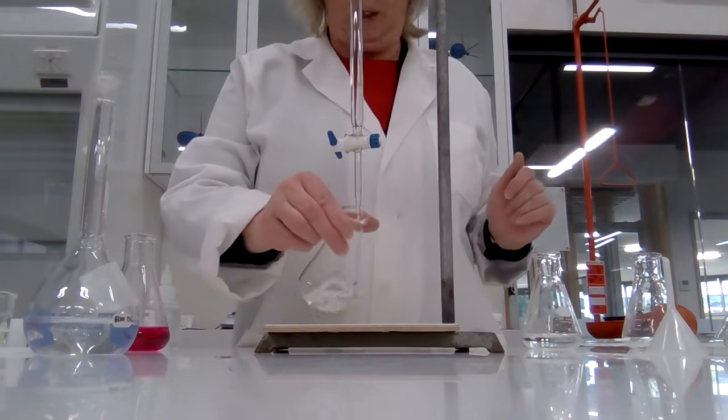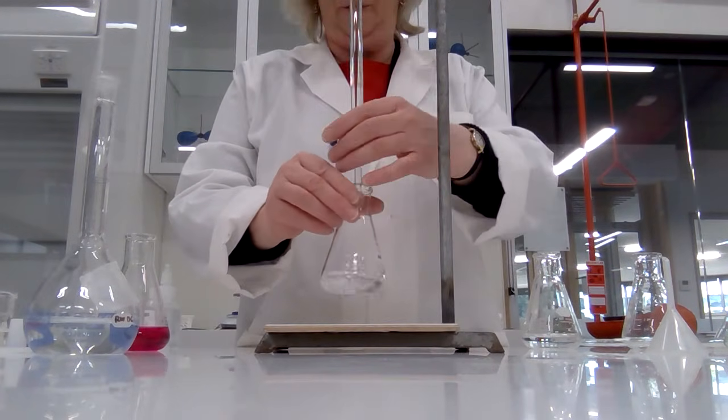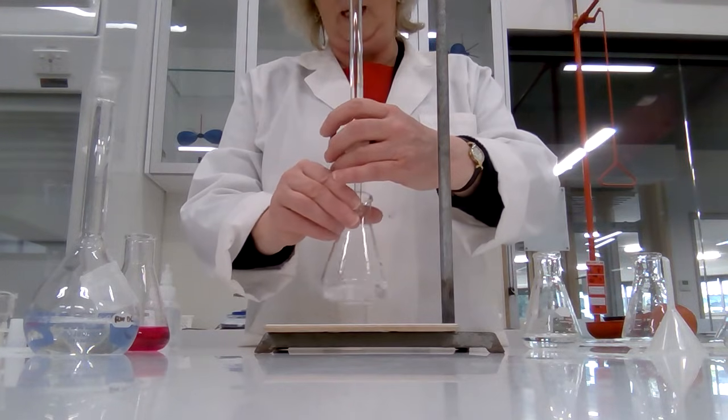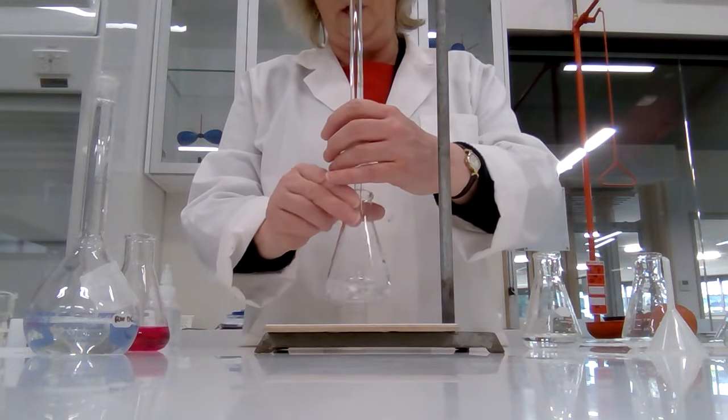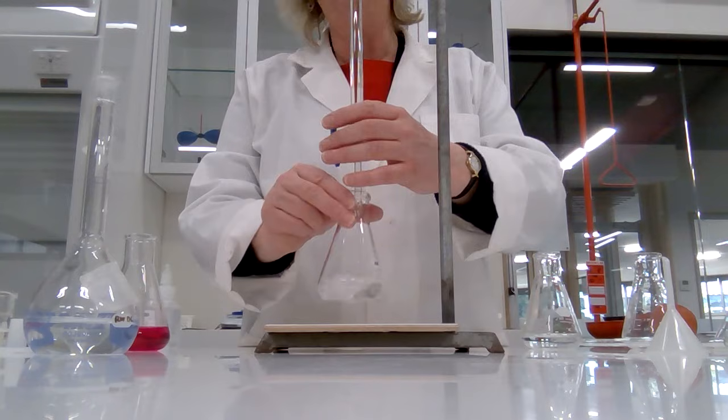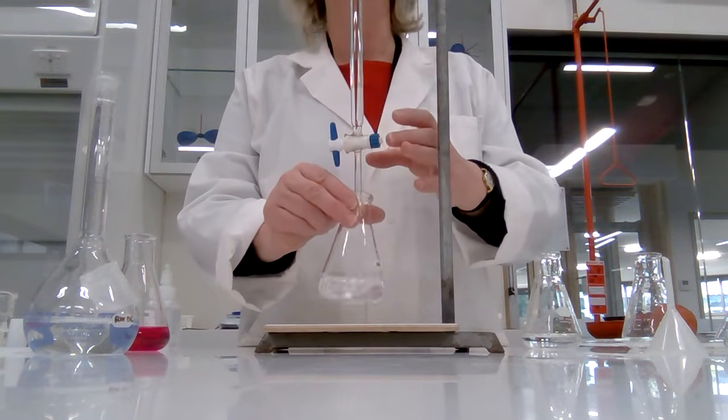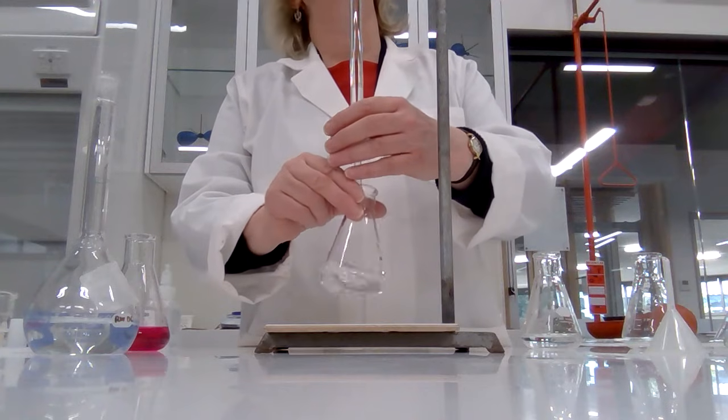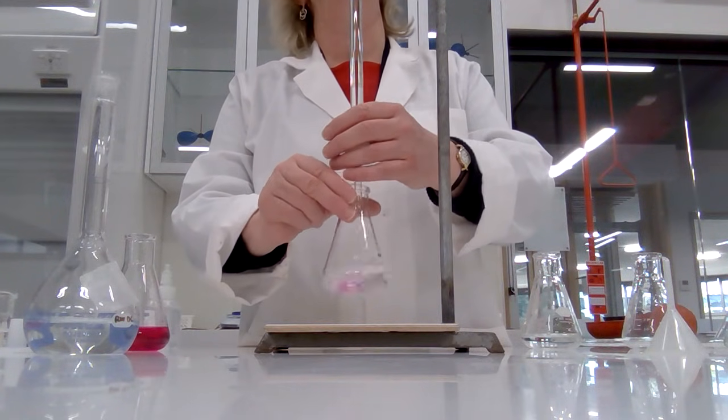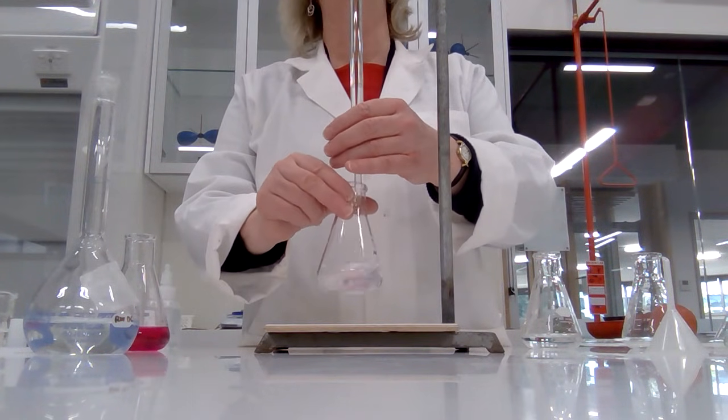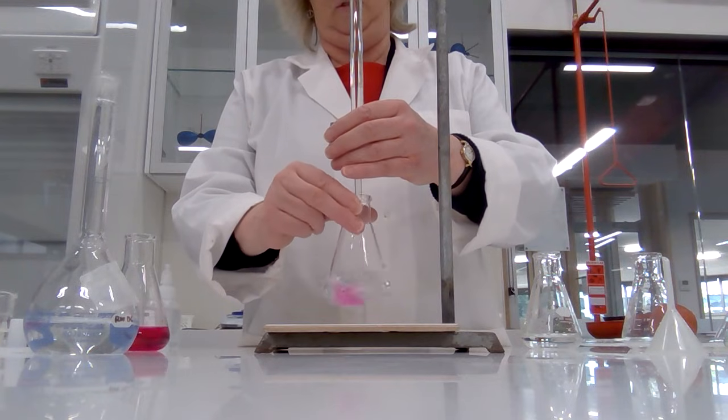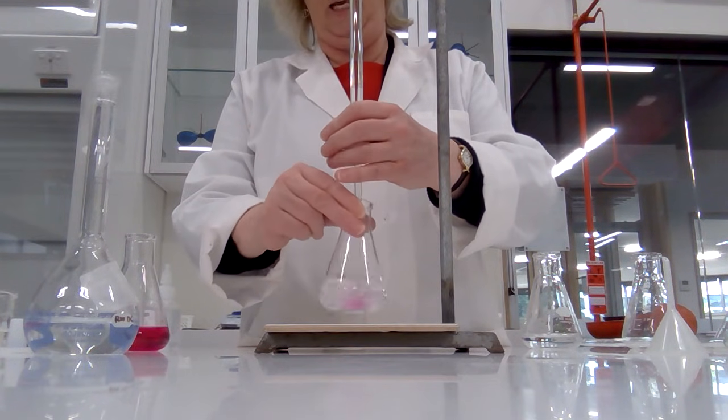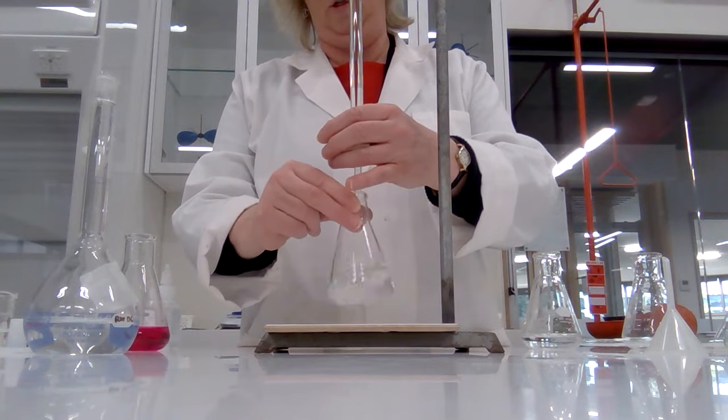And we're up to titration number five. Away we go, started on 1.30, hoping to go down to 21.30. So we're heading downwards.